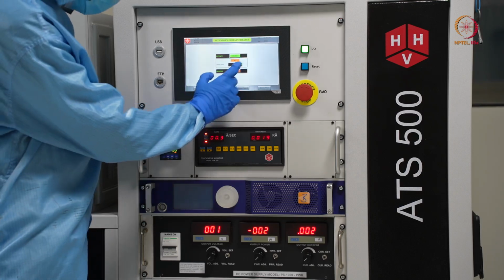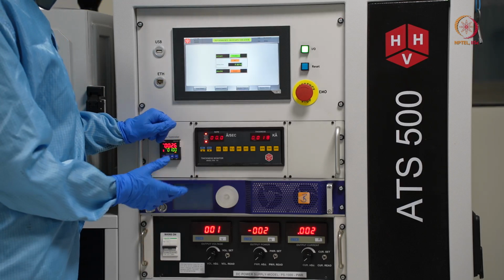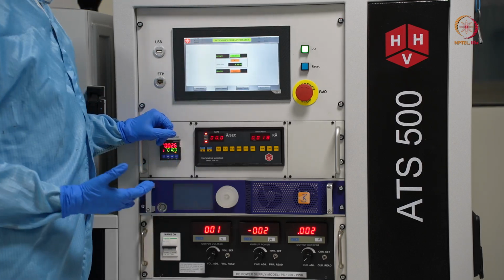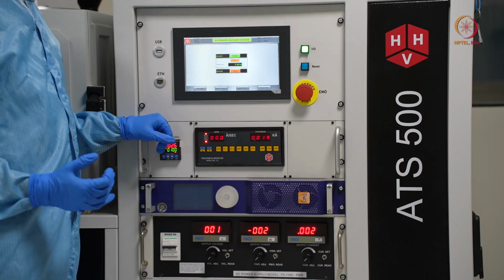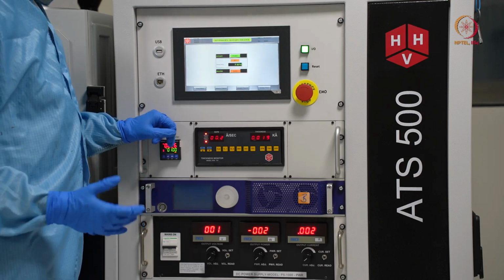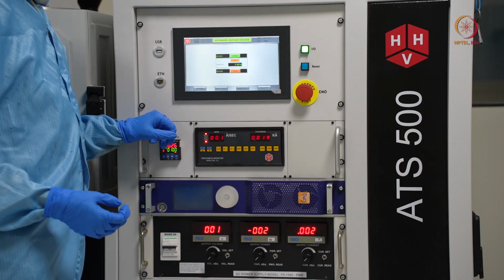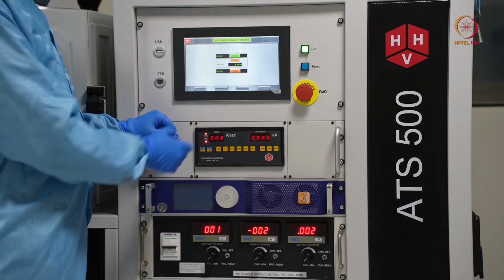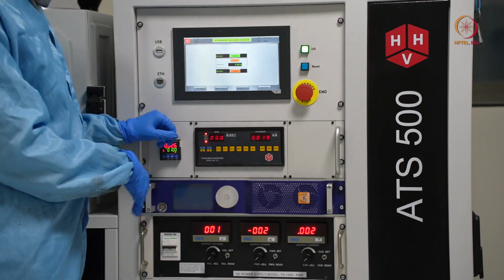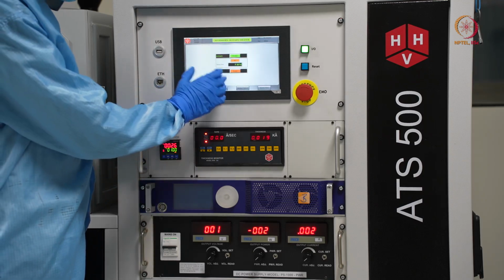So here this is done. Now we may enable the heater also, but we are not showing it now, because for this type of deposition, like metal deposition on glass, that doesn't require any type of extra heating. But in case of any insulator deposition, usually we may prefer to deposit at some higher temperature. In that case, it is always better to use this heater and deposit the material.